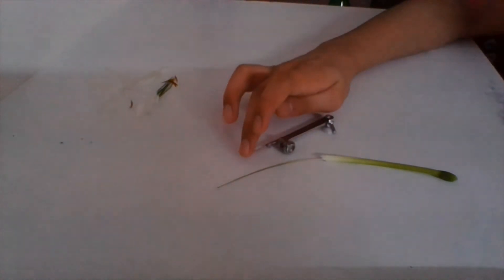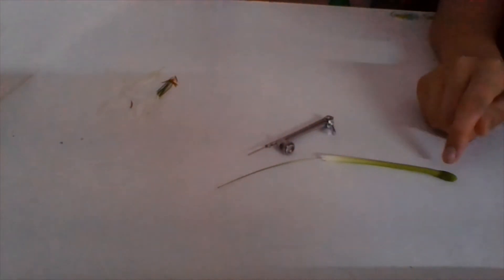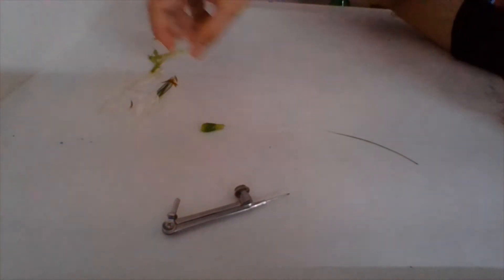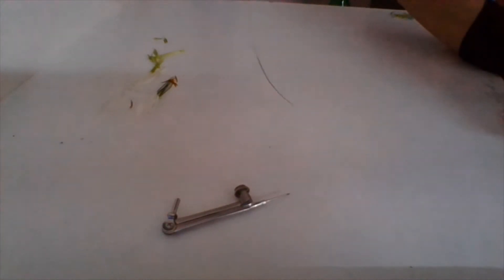I will just dissect it now using my compass. Using the sharp end of the compass I will dissect and reach the ovary. As you can see, I have taken out all the extra parts, and this is what I get — such a long style.